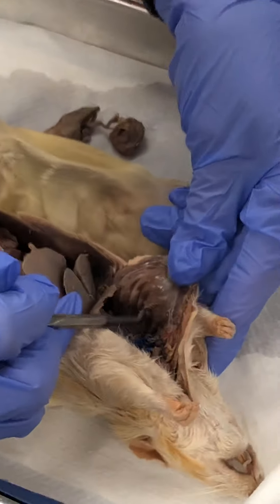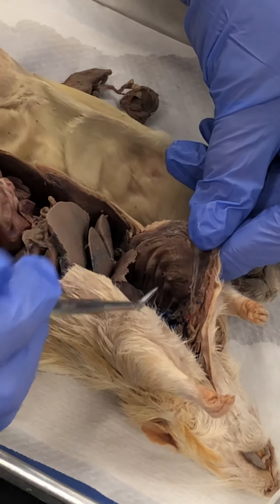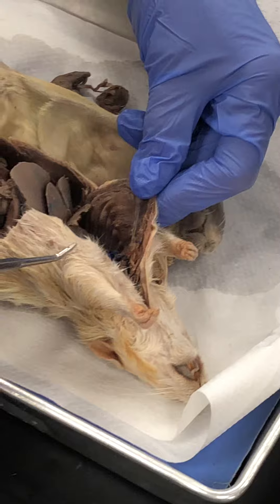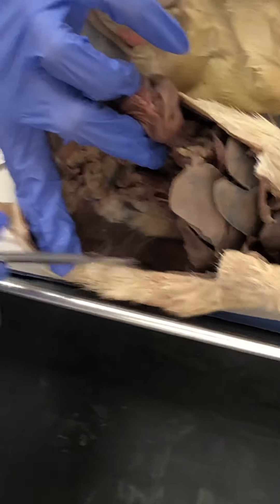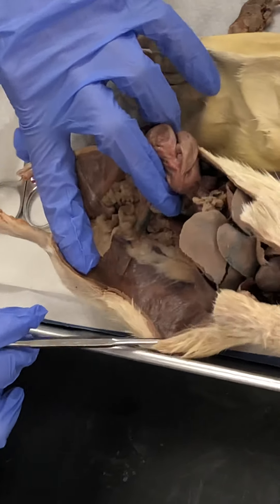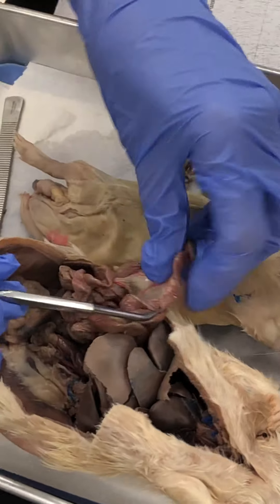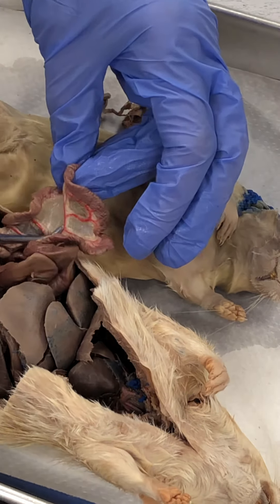You do have to know the parietal pleura — that is the membrane that lines the chest cavity. You don't have to know visceral pleura or pericardium. The parietal peritoneum is the membrane that lines the abdominal cavity. And then this is your mesentery — you don't have to say 'true,' just say mesentery.